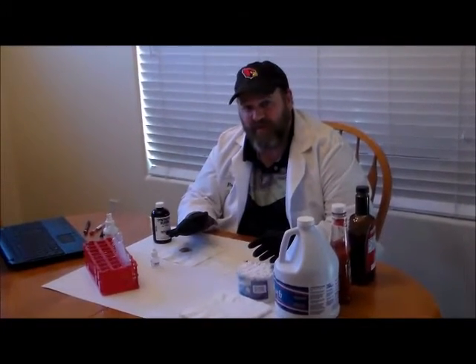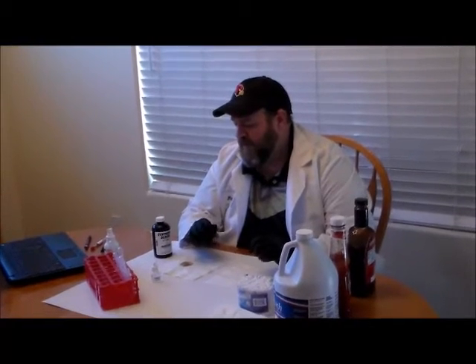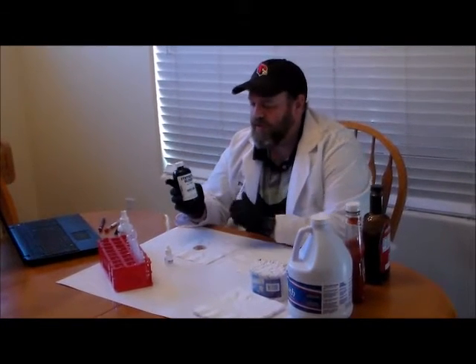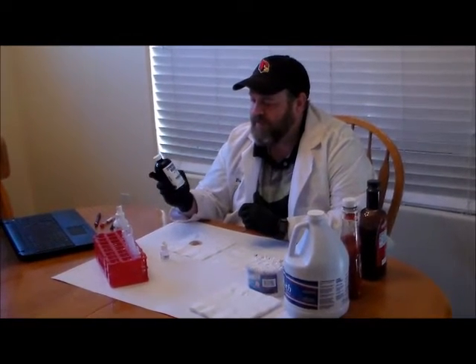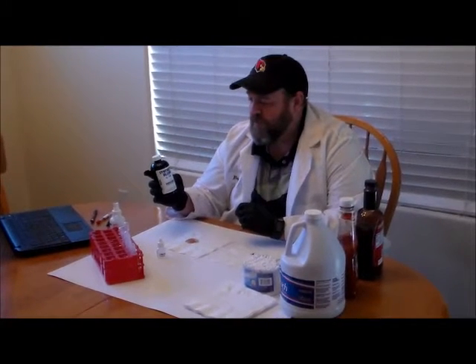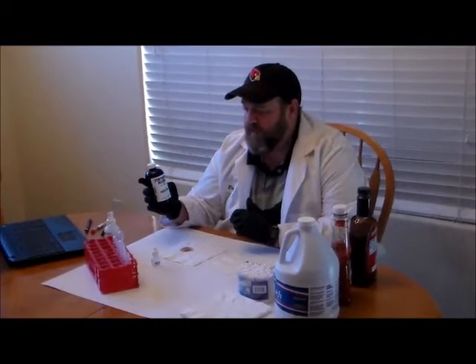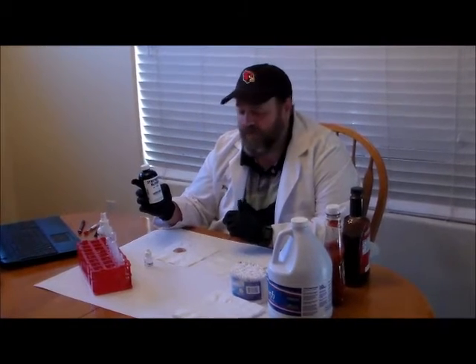And then to take a look at some substances that kind of look like blood and figure out whether or not they give a positive for some of these tests. One of the things I forgot to mention is that you'll have a smaller vial in your lab kit labeled as synthetic blood. This is a substance we purchased from our forensic distributors — it's not blood, but it behaves similarly to blood, so it's good for testing our reagents to make sure they're actually working.